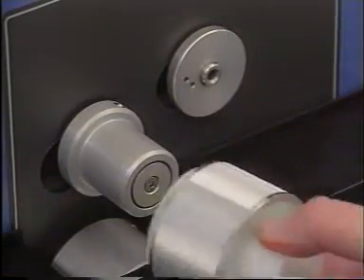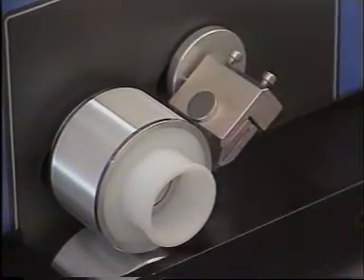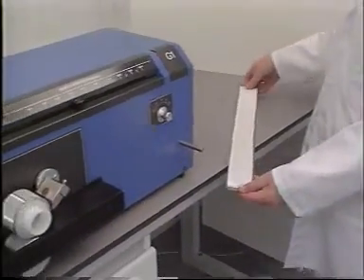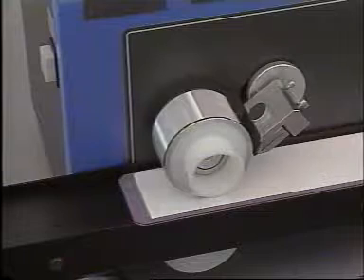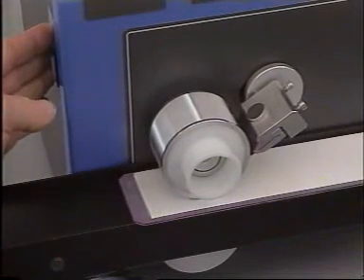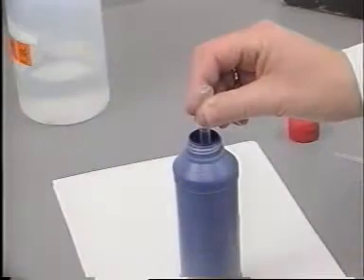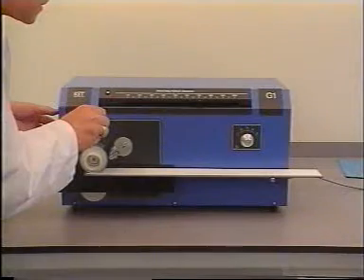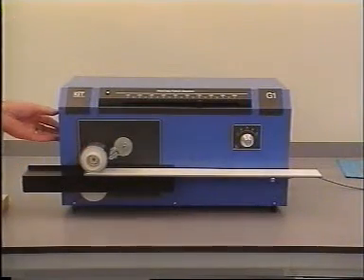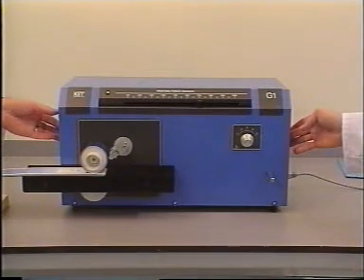The engraved disc and the doctor blade holder with doctor blade are slid onto the G1. The substrate carrier with the substrate is placed on the substrate guide on the right. The engraved disc is pressurised by depressing the button on the left of the G1, and the doctor blade is simultaneously moved against the engraved disc. A few drops of ink are dripped into the nip between the doctor blade holder and engraved disc with a pipette. The print is made by depressing the button on the right of the machine.